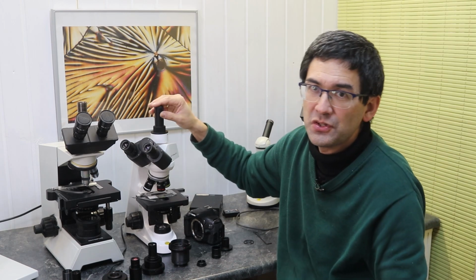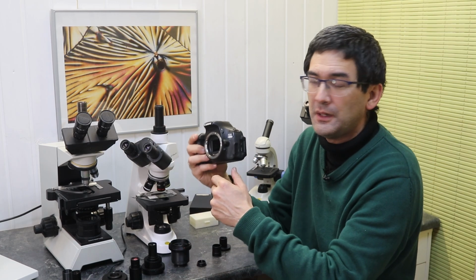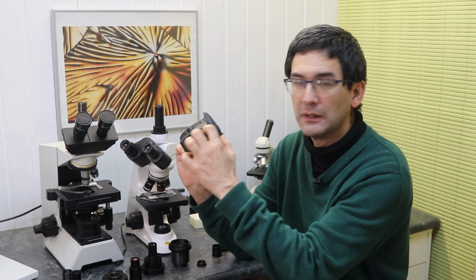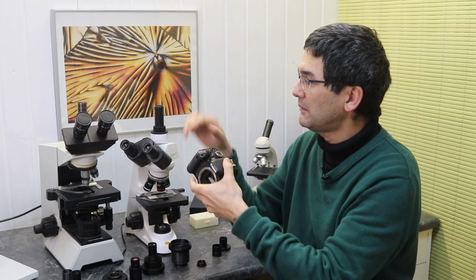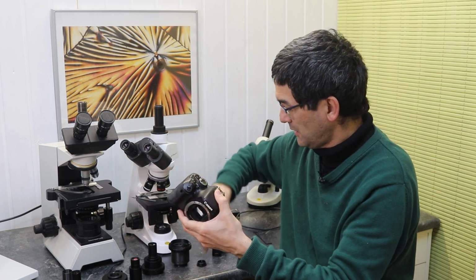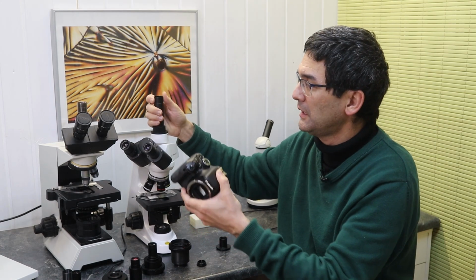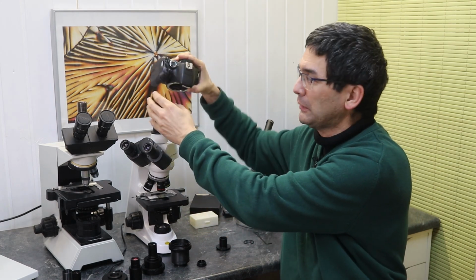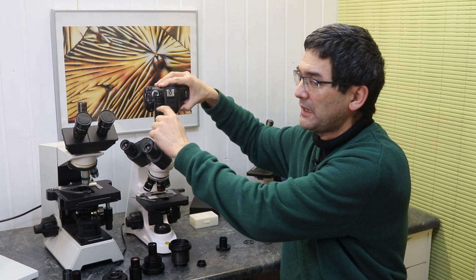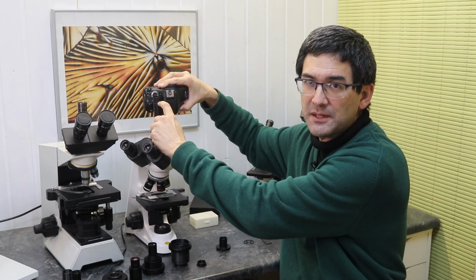Now, what if I want to connect a DSLR camera to my microscope here? You have to understand that the sensor of the DSLR camera is somewhere in the middle over here, okay? And this means that when the tube is still connected on top, approximately 1 centimeter down into the tube, this is actually the place where the camera should be located. So it actually has to be down like this, so that the sensor and the place where the image is projected, 1 centimeter down into the tube, are basically at the same place.